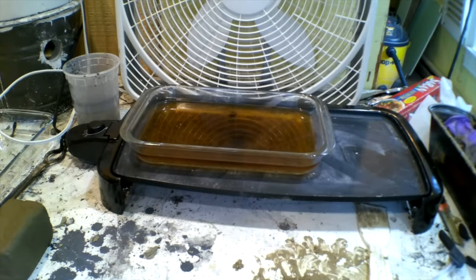They're a very funny color — it's kind of amber. It doesn't appear to be going away as I evaporate, which the green did. So I think I'm going to wind up with a brown residue, which means I'm probably going to have to recrystallize more.